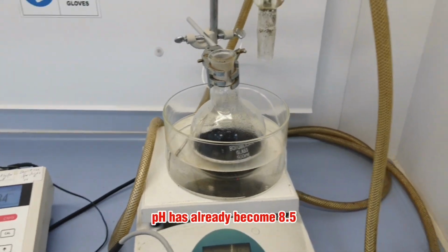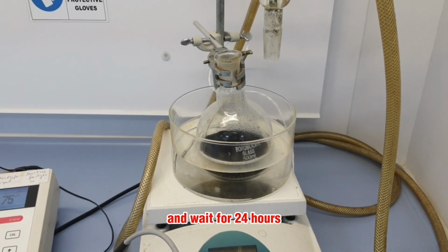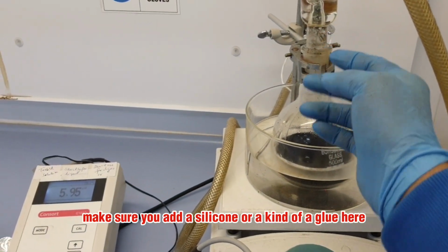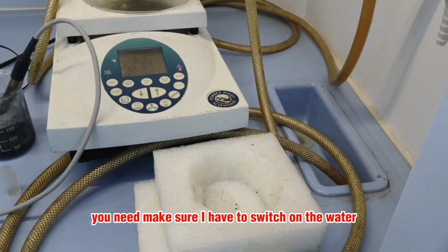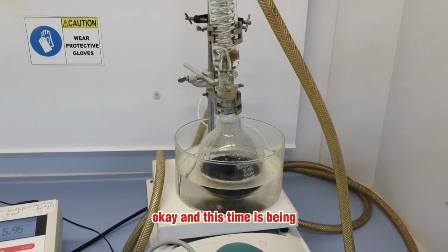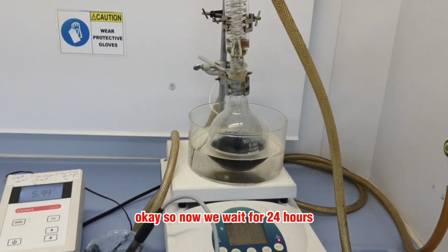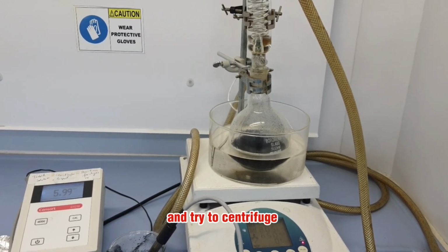The pH has already become 8.5, so now I will cap the whole system and wait for 24 hours. Now I have capped the system. Also make sure you add silicone or a kind of glue here. You also need to switch on the water so that the water flows and the system is constantly cooled by the water. Now we'll wait for 24 hours. After 24 hours we'll take the whole assortment and centrifuge.